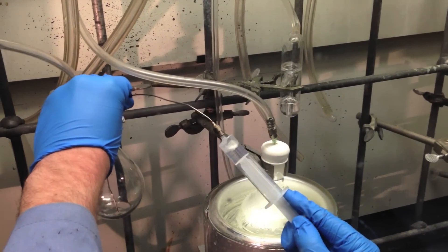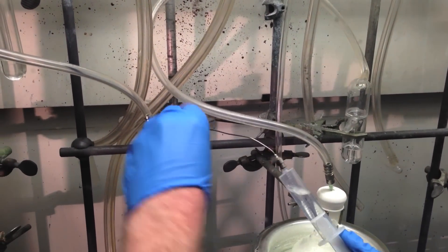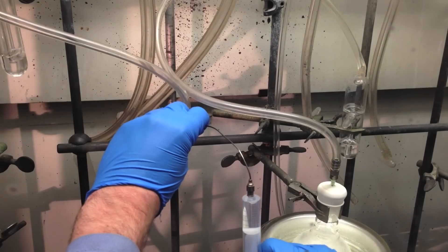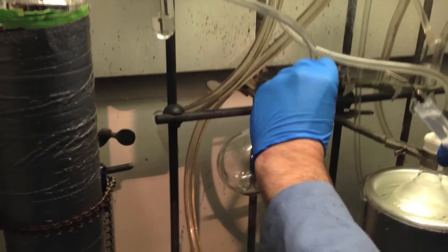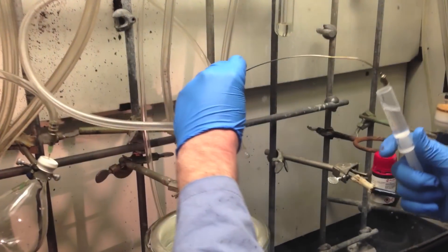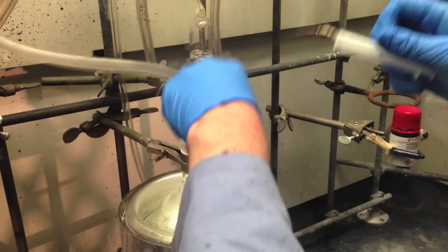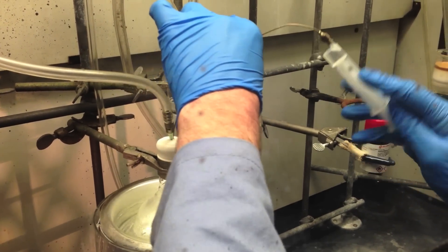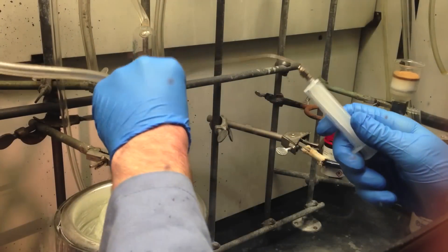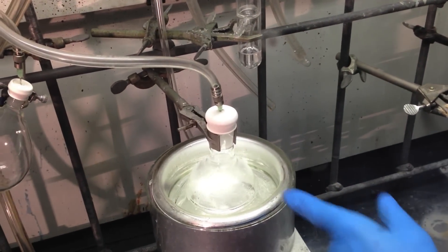This is a modestly air-sensitive reaction, so all of the reaction apparatus is under nitrogen gas — you can see the bubbler indicating that the gas is flowing. I'll rotate the flask a little bit sideways to get every last drop. I've done several rinses to add the compound, and I'm going to wash out the needle by sucking some of the reaction mixture back up into the syringe and plunging it out to get as much of that compound in there as possible. Now I'll turn on the stirring — you can see the magnetic stir bar spinning inside.